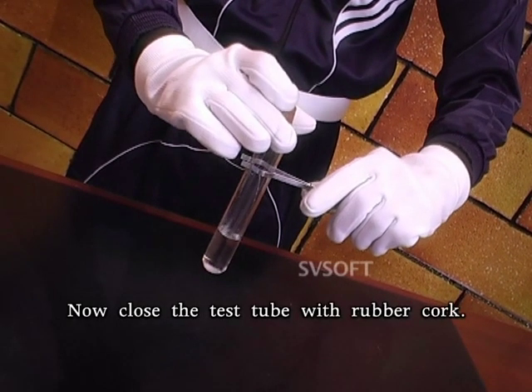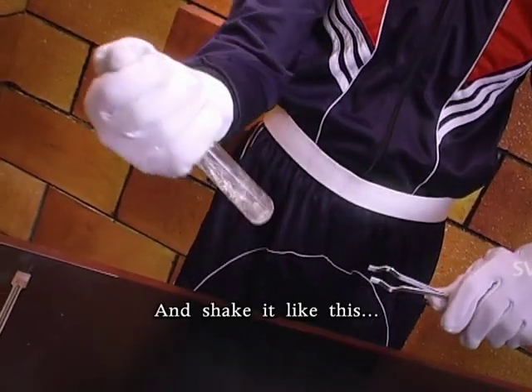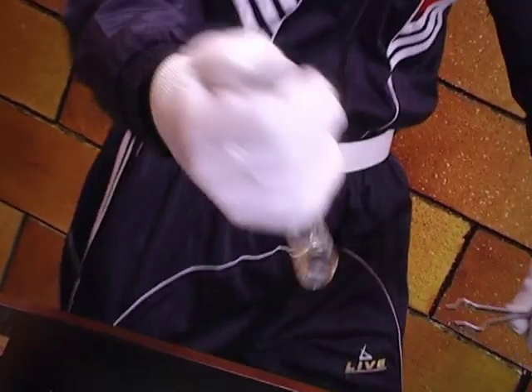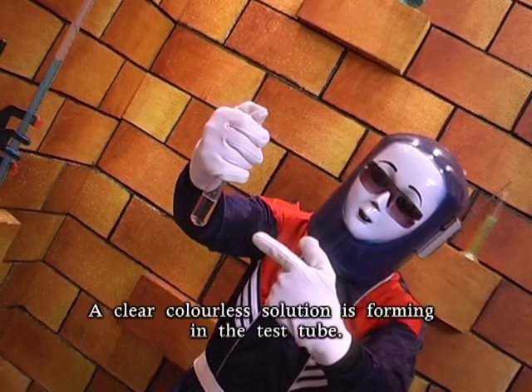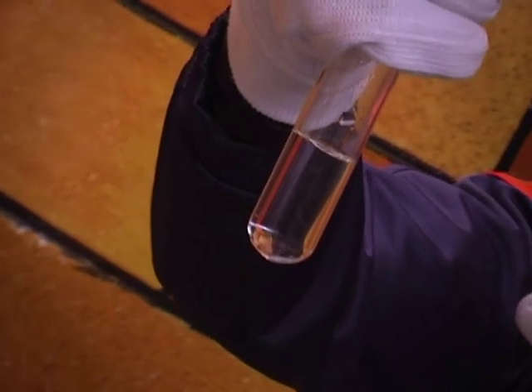Now close the test tube with a rubber cork and shake it like this. Friends, observe it clearly. A clear colorless solution is forming in the test tube. This is called a solution.